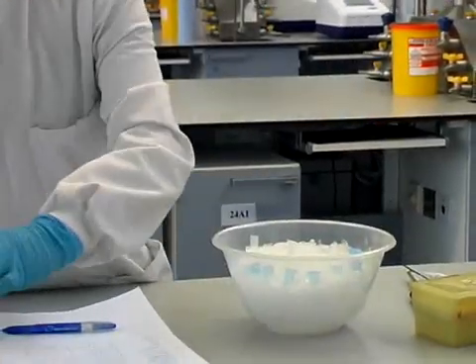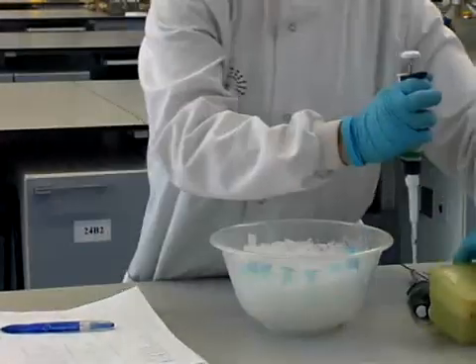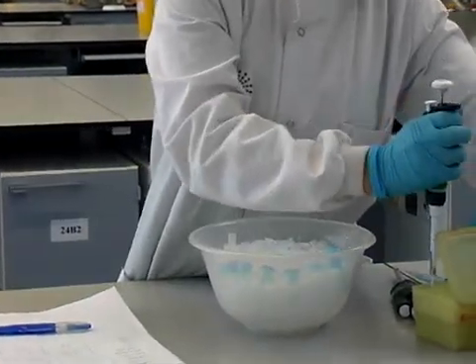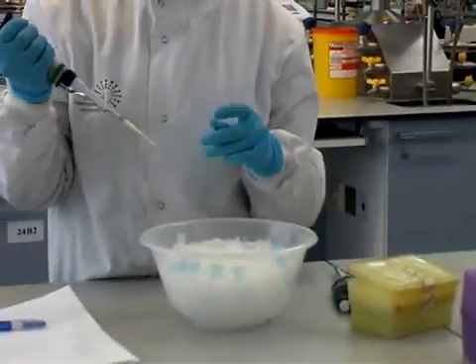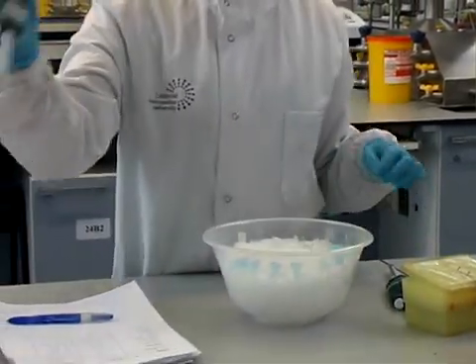The next reagent is magnesium chloride. Between reagents always make sure you change the tip so you don't contaminate your reagents. Magnesium chloride will be added.